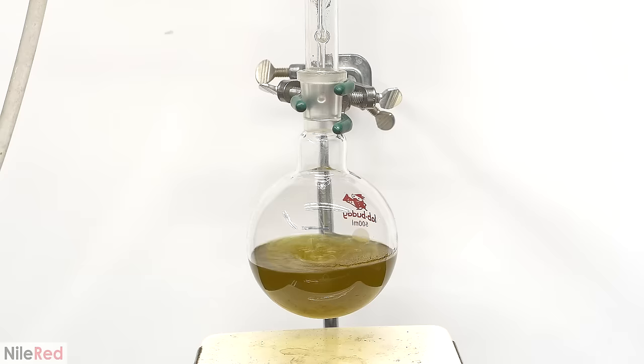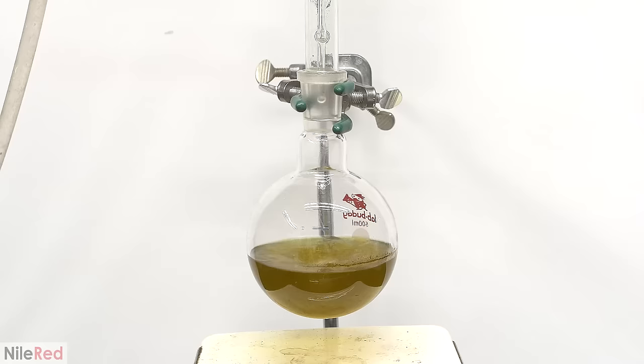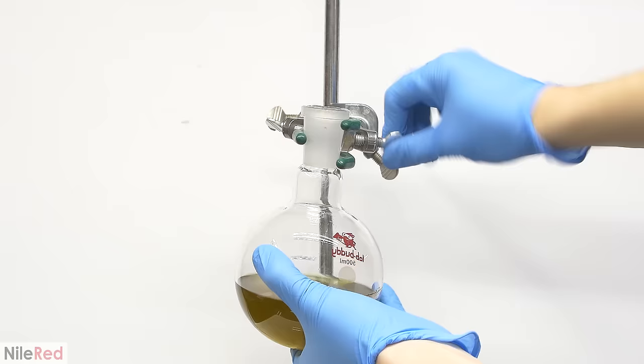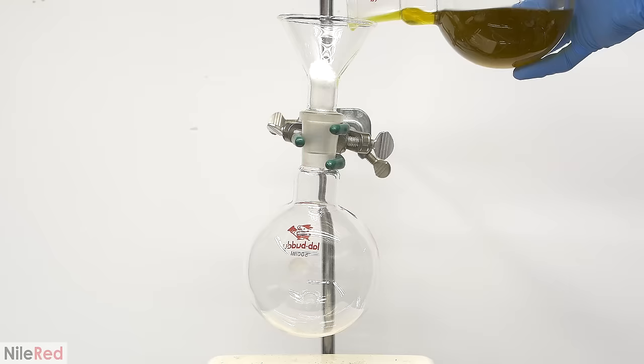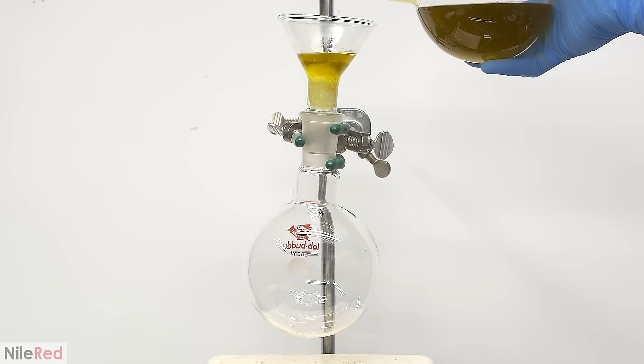So two hours later, I was left with this yellowish brown liquid. The solution contains the piperine, but it also has a bunch of other stuff that was extracted along with it. This includes things like fats as well as anything that's soluble in hot isopropanol. A little bit of the pepper made it past my cotton, so before moving on, I need to quickly filter it.